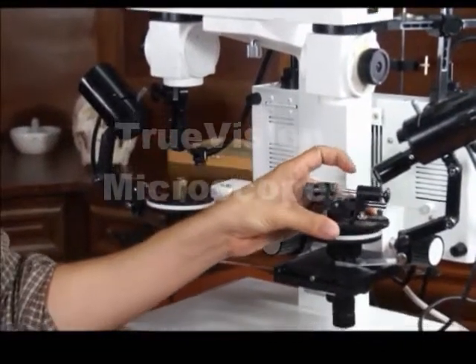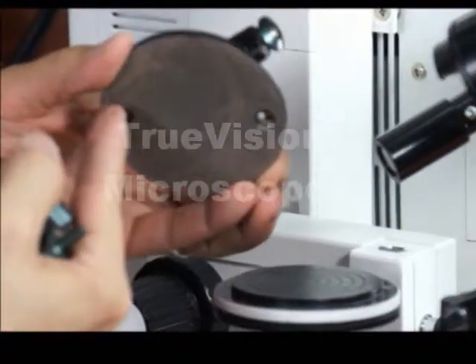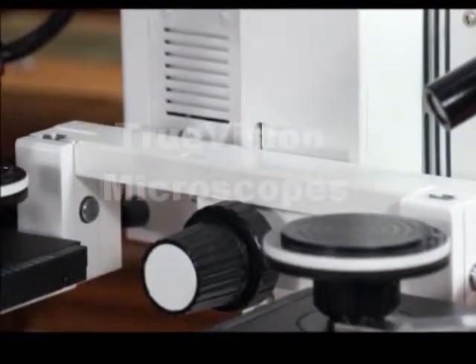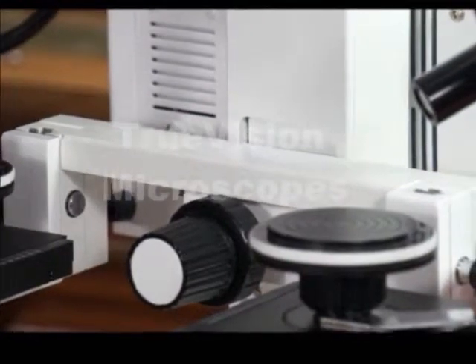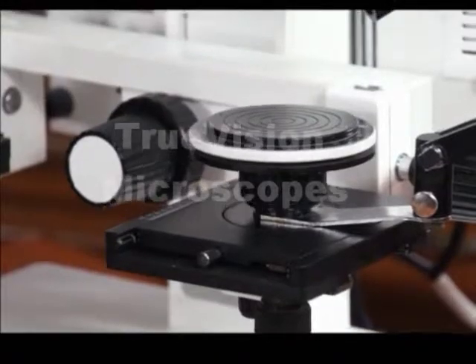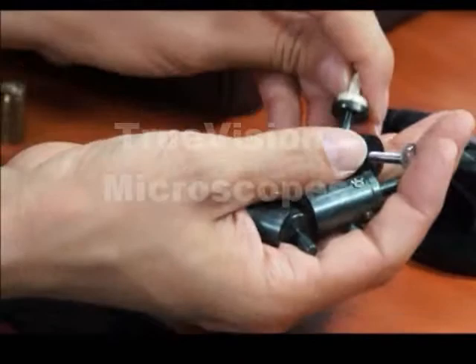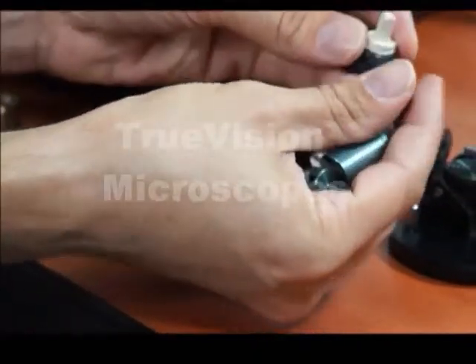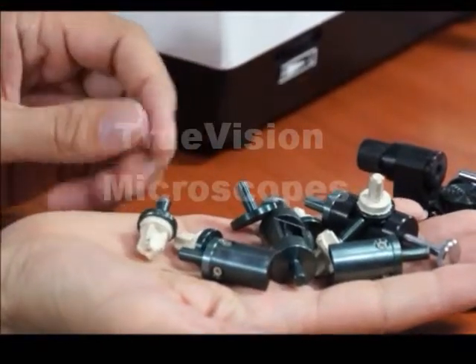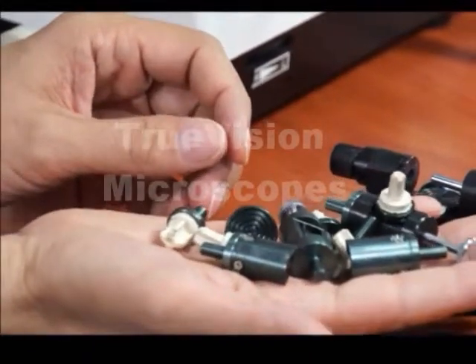We also have a bullet holder. The bullet holder can be tightened down to the stage — there are two screws and two screw holes. The bullet holder also has a variety of adapters and holders. These can be used for holding small bullets and positioning the cartridges.